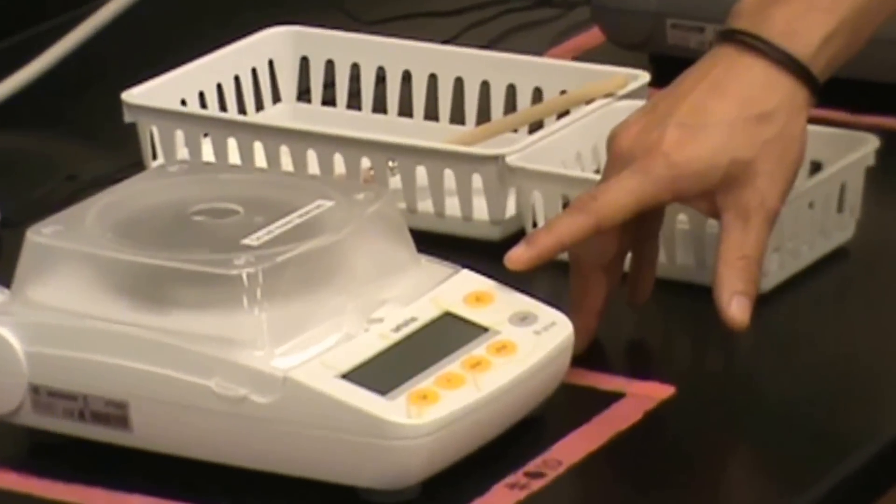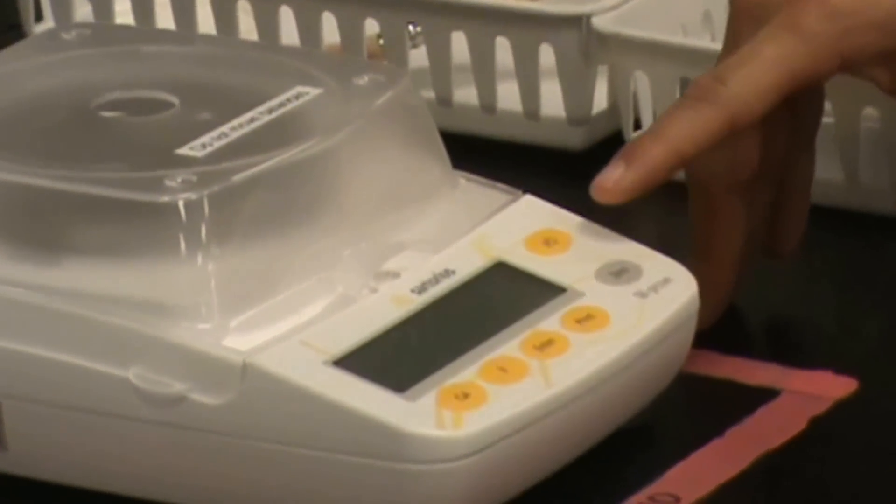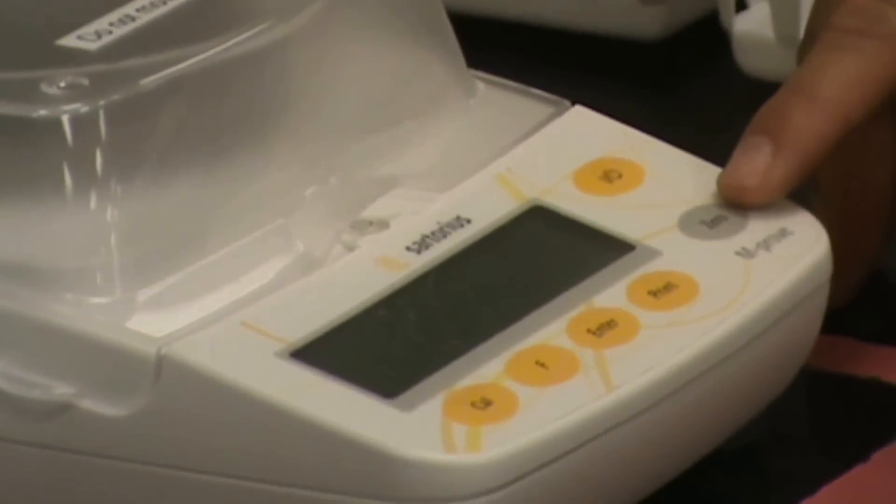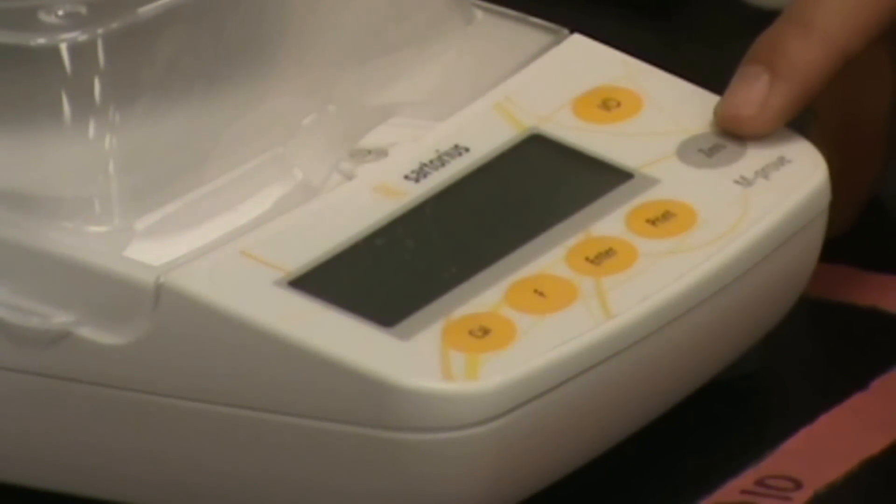There's only two buttons that you're going to want to use on this balance right here. We have a power button located in the upper right, and a zero or tare button located just below that.